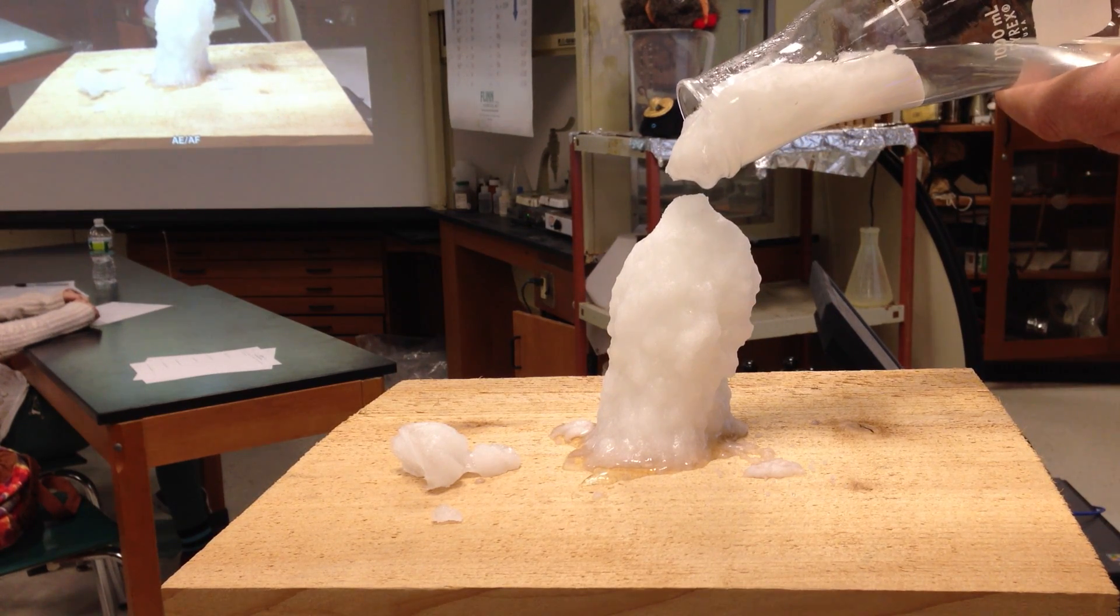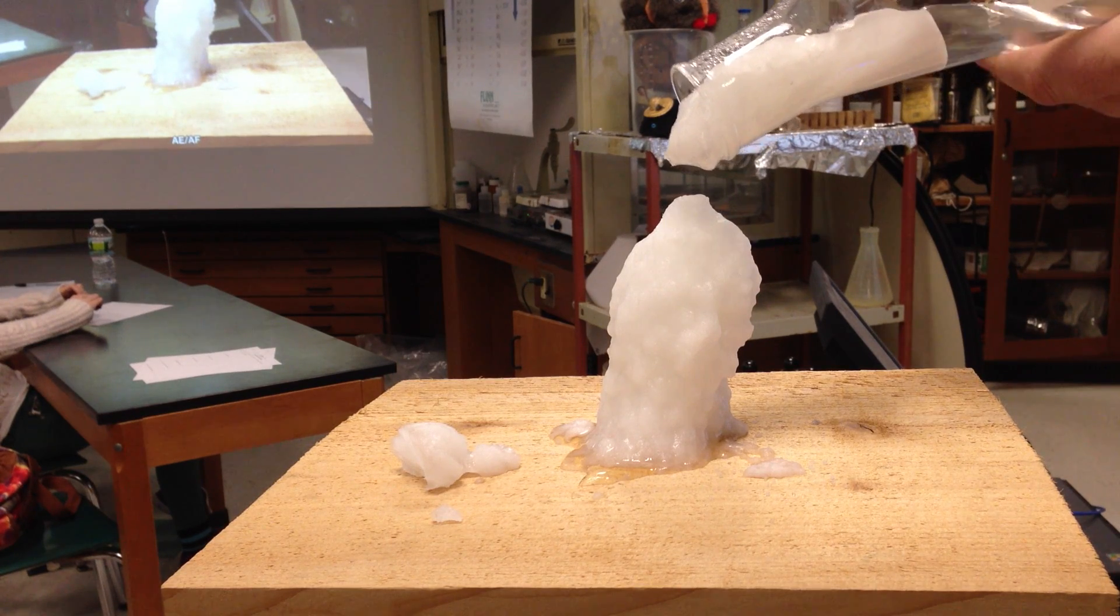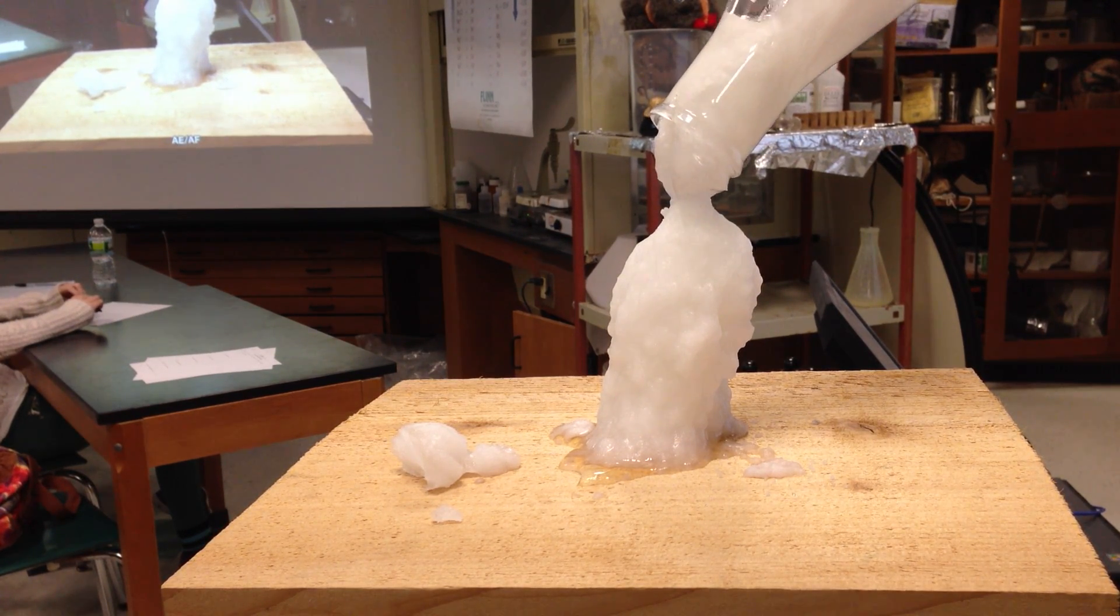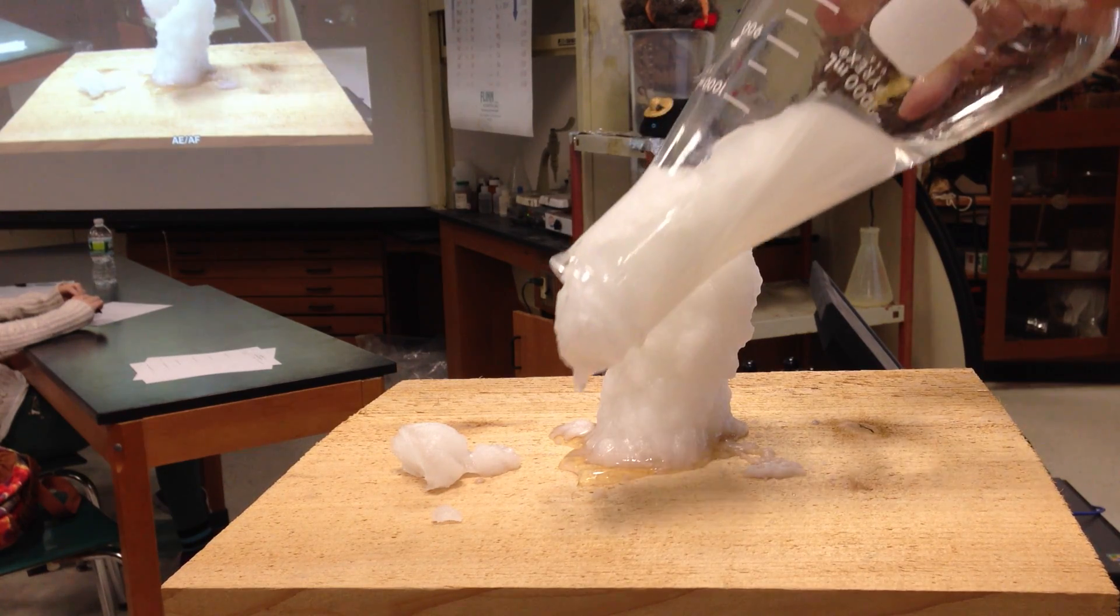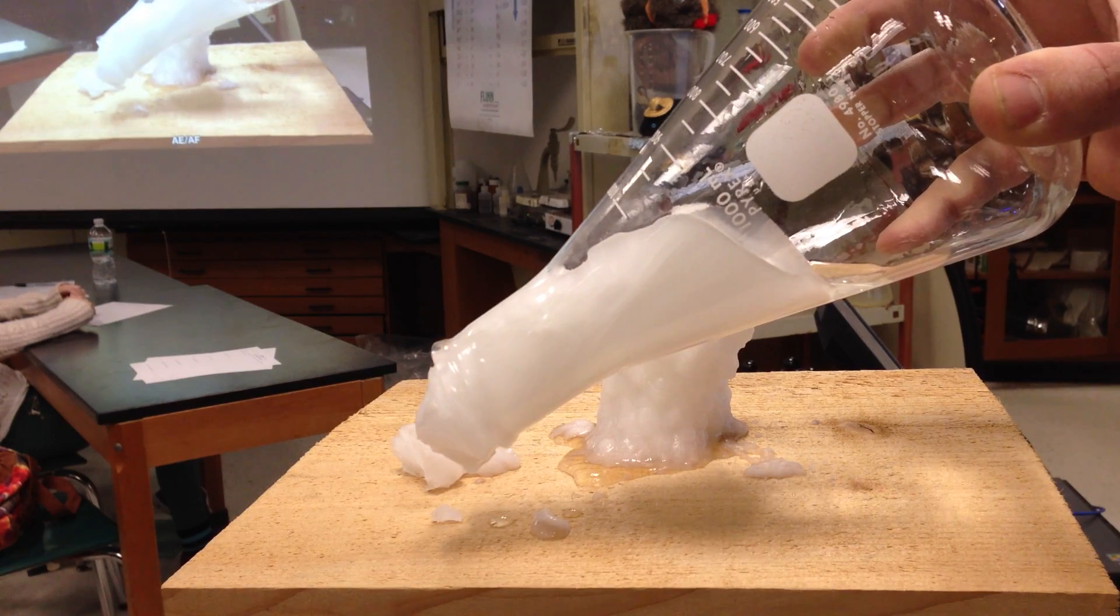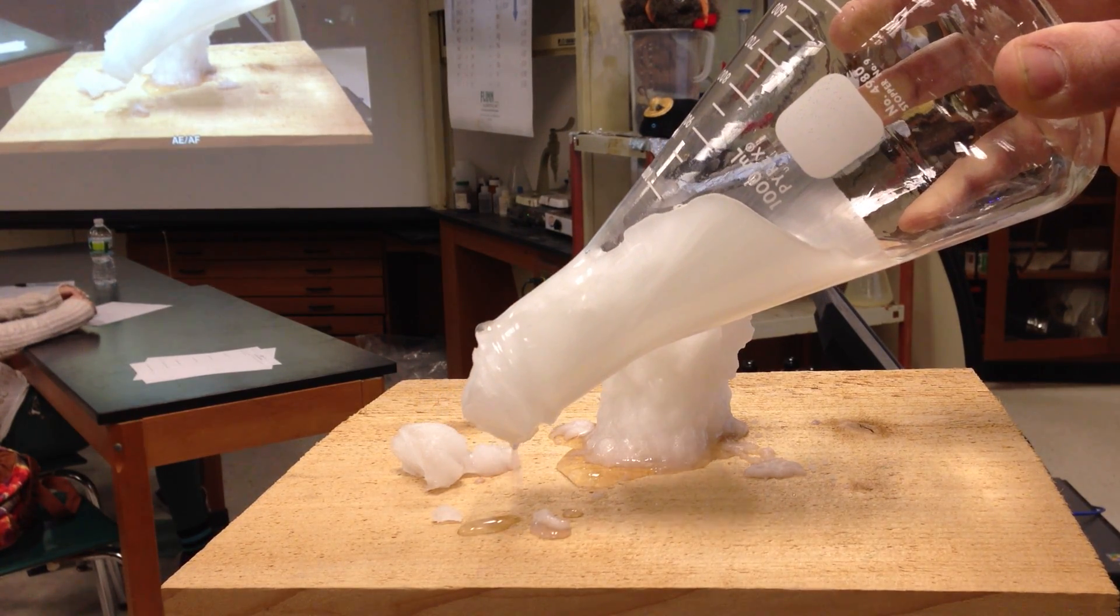It's a beautiful piece of art. And I'm left with a crystalline solid in the middle.